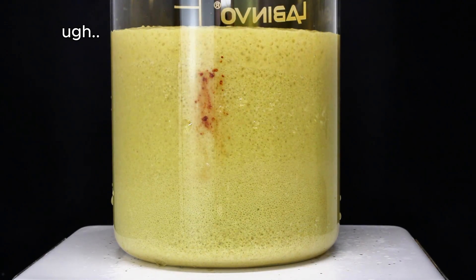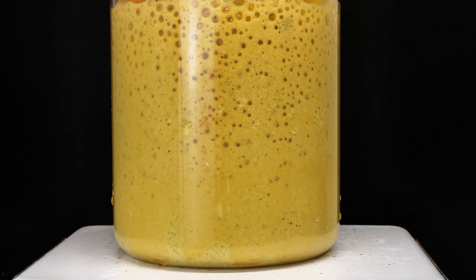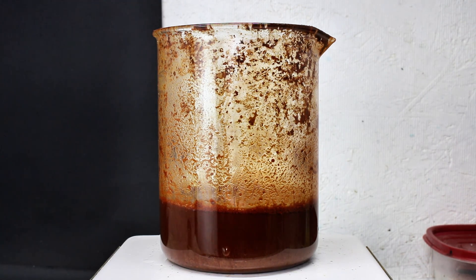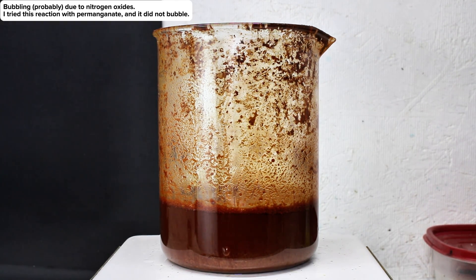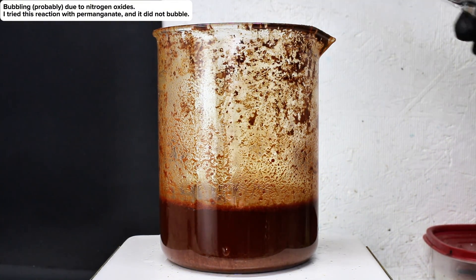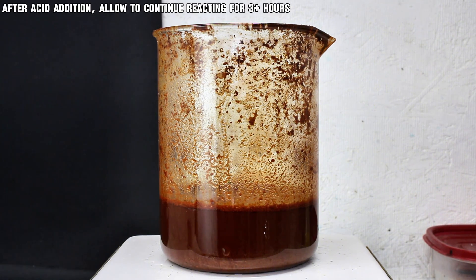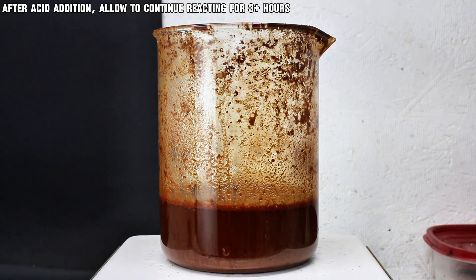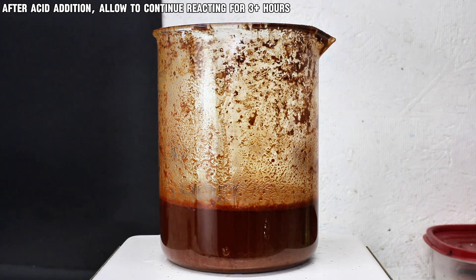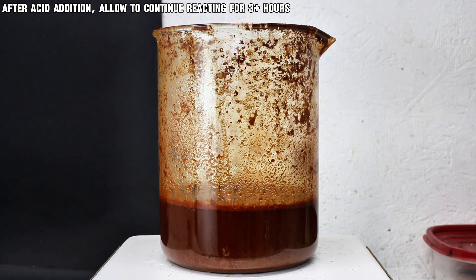Unfortunately, once the reaction really got going, it still managed to be aggressive enough to nearly bubble over in my beaker. If I do this reaction again, I'll just have to use a 2-liter beaker. As far as I can tell, this bubbling is due to nitrogen oxides released upon the initial oxidation of paracetamol, but I'm still not entirely certain. Anyway, once the reaction died down, I added the rest of the nitric acid and let the mixture continue reacting overnight. In all honesty, this was probably way too long and likely hurt my yield, but the reaction needs to go at least a few hours to go to completion, and when I got to this step it was going on midnight and I needed to be up for work at 6am.